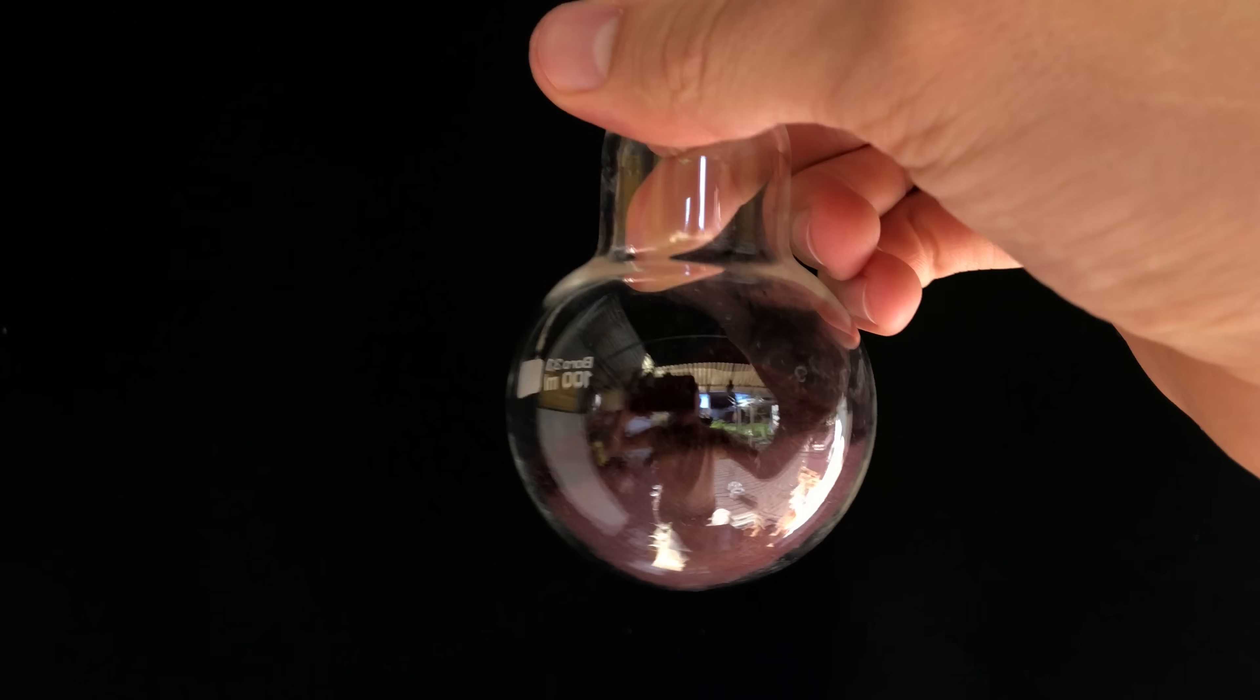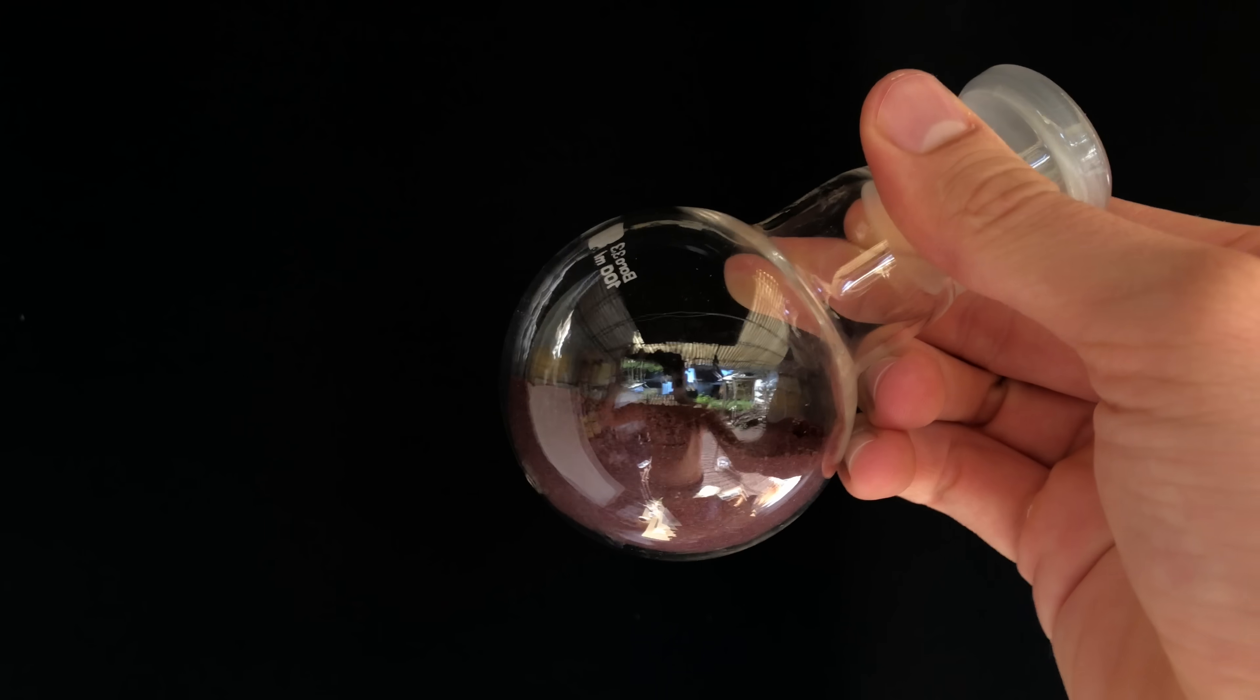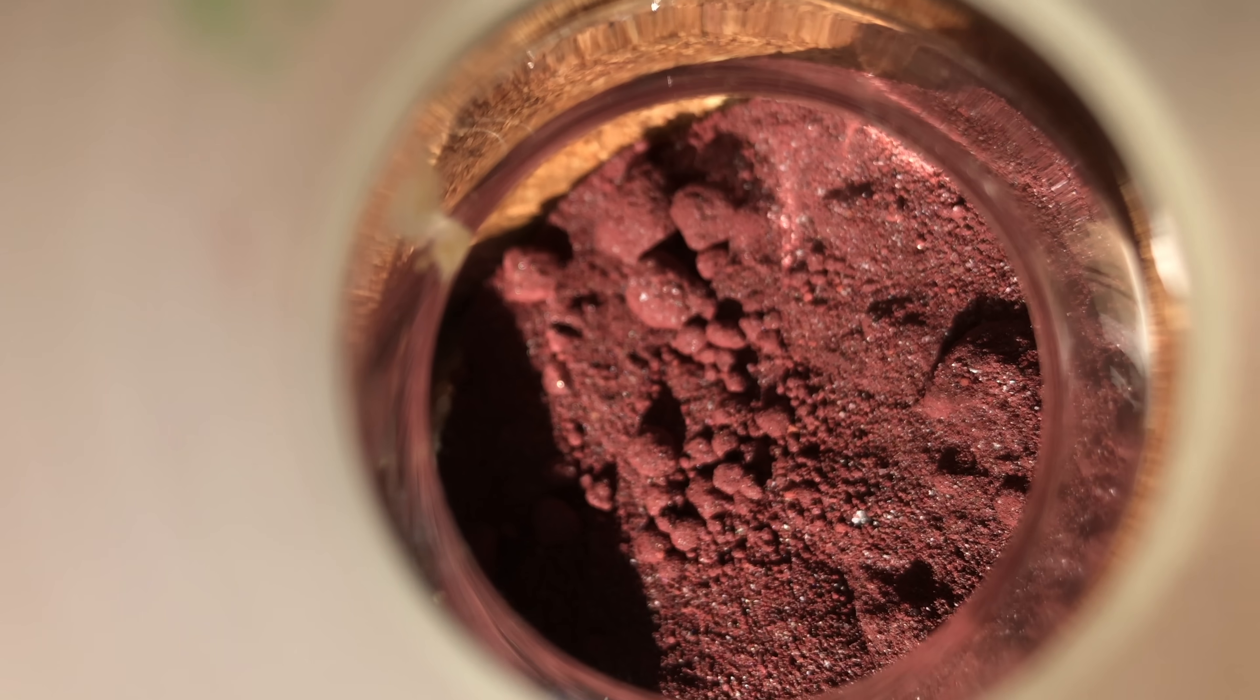You have likely never seen it on YouTube before, but I am going to make extremely clean white phosphorus and for this we are going to need red phosphorus as a starting material.